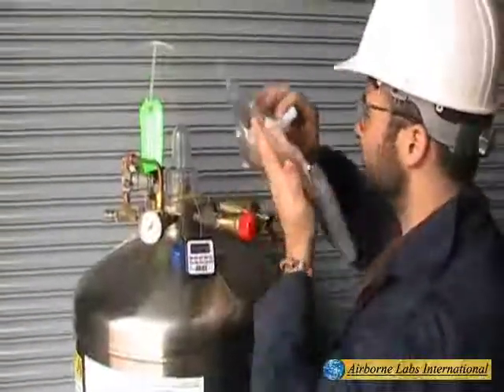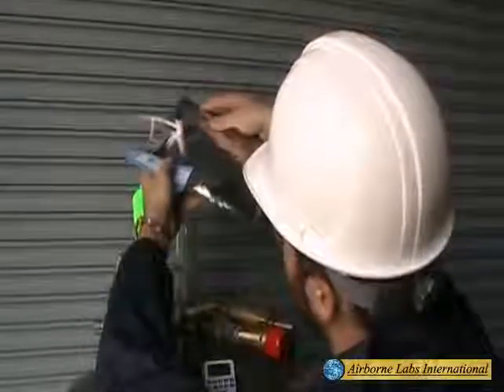After two fill-purge steps, reattach and fill the MLB to near full, approximately 80%.